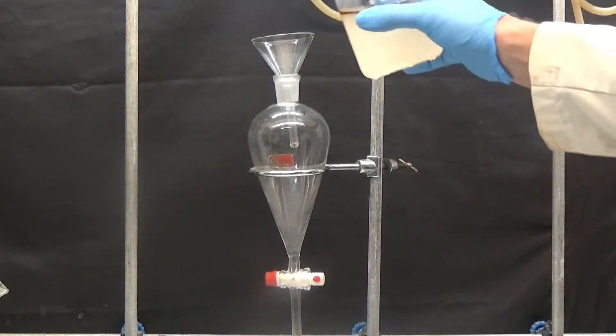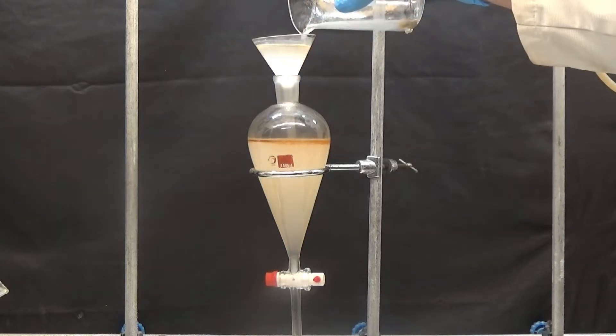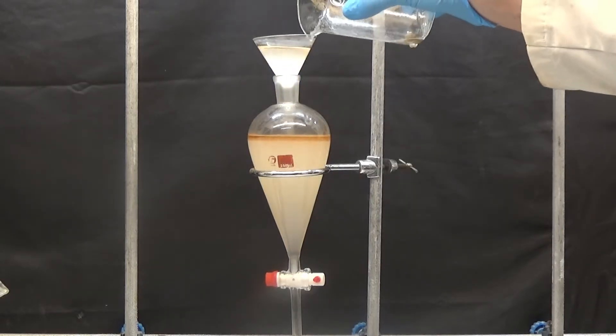After 30 minutes, put the contents of the glass into a separating funnel and leave it to rest for 12 hours to decant all the purified salicylaldehyde.